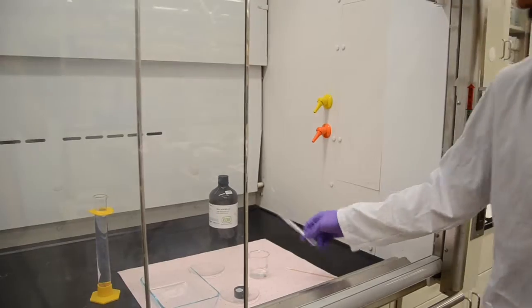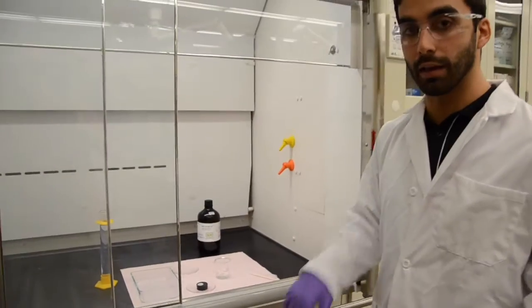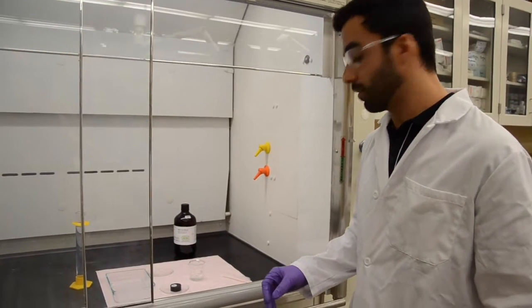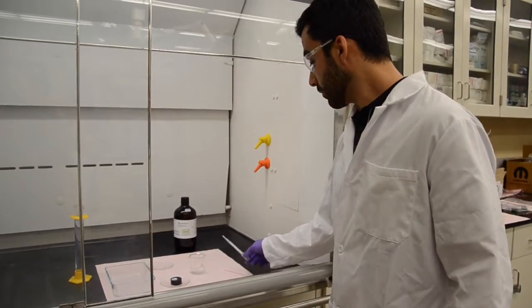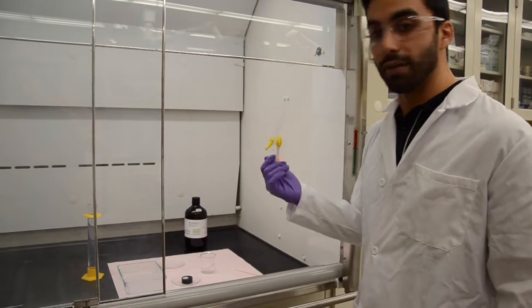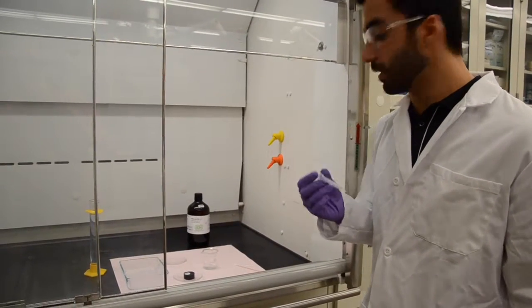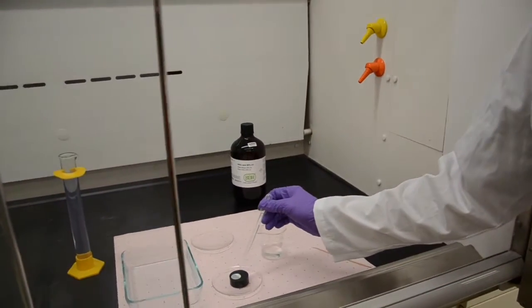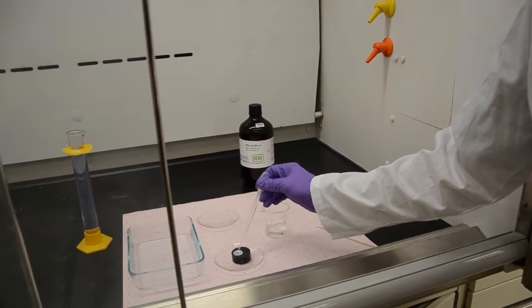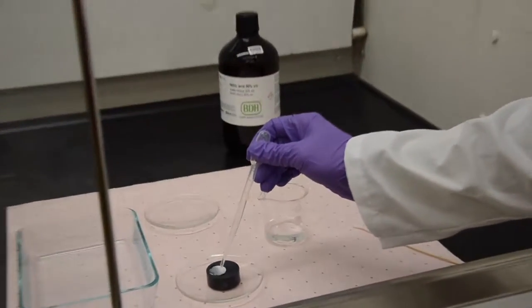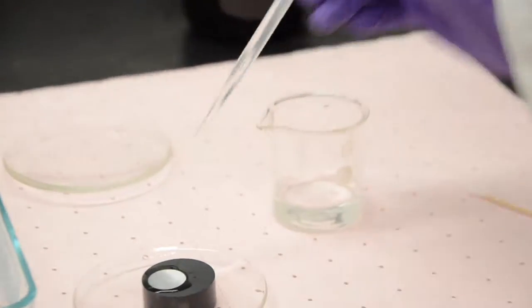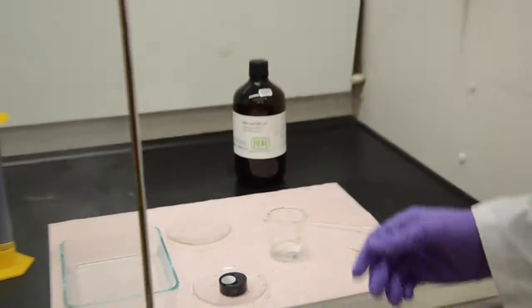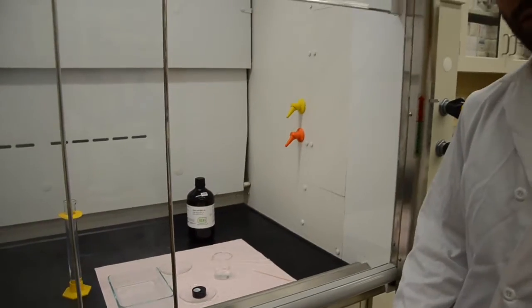For etching, you want to wear safety glasses, gloves, and a lab coat to protect your arms from possible splashing on your skin. For etching, I suggest using a plastic pipette, take the solution and then just cover the surface of the sample you want to etch. That way you produce the minimal waste.